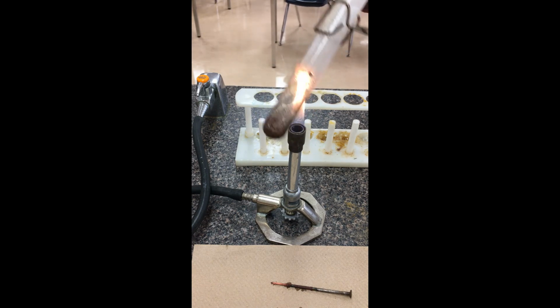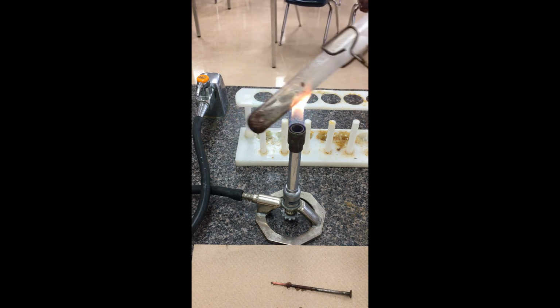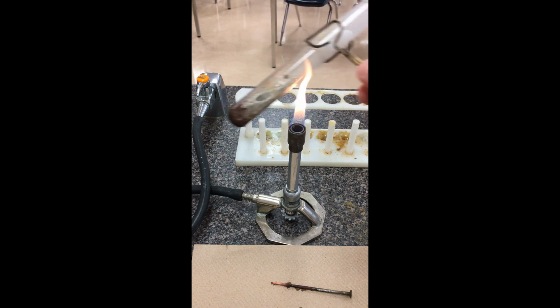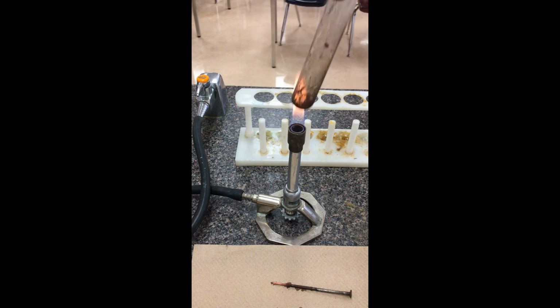You would wait till it has cooled down a little bit, and if you were interested in figuring out how much solid was left over, we can just weigh it at that moment. Okay, so there's our example of a flame dry. I'm keeping this moving so you don't concentrate the heat at any given area. If you're worried about fumes, you can definitely do this inside a fume hood as well.